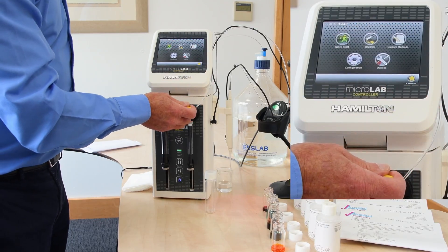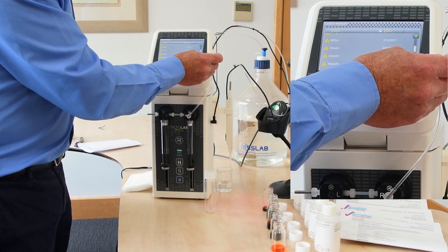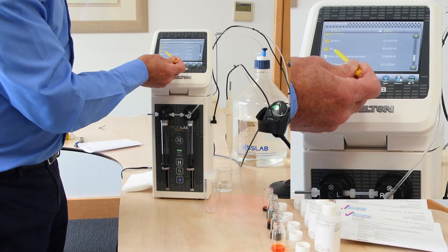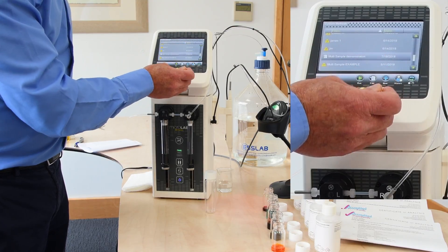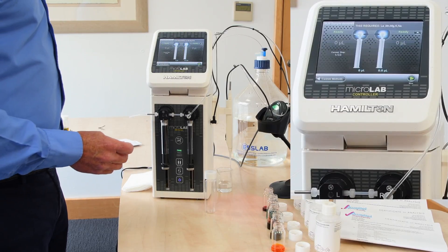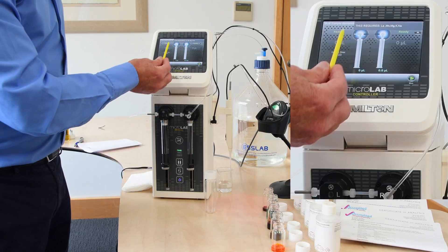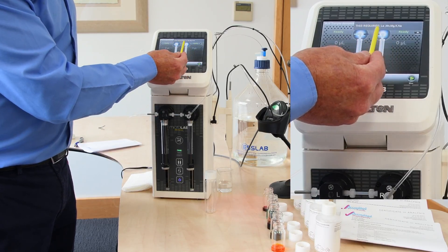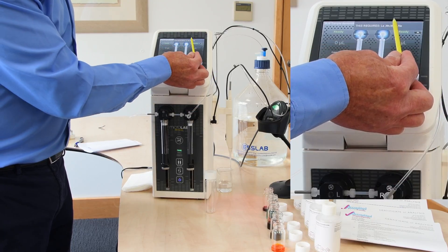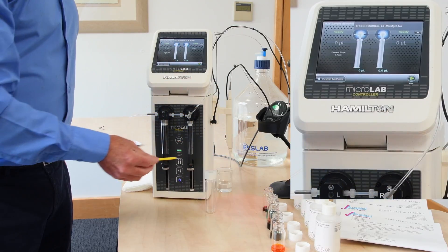Within custom methods, I'll scroll down to the method I created for this application, which is the multi-sample demonstration, and select and run that program. Straight away it gives us a header telling me that this standard requires specific standards — a lanthanum, manganese, magnesium, potassium, and sodium standard — and those standards are in front of me.